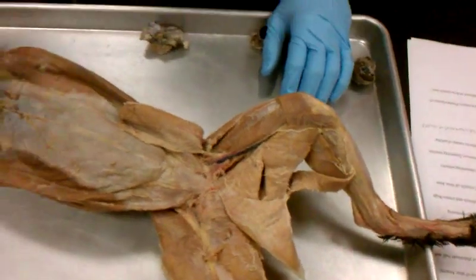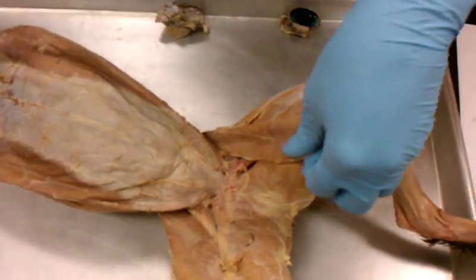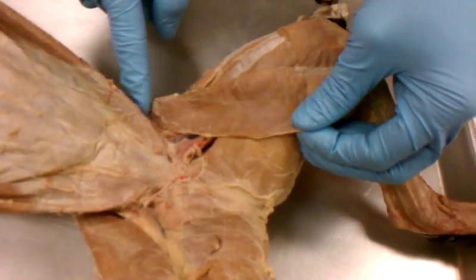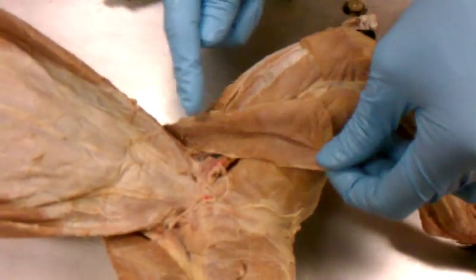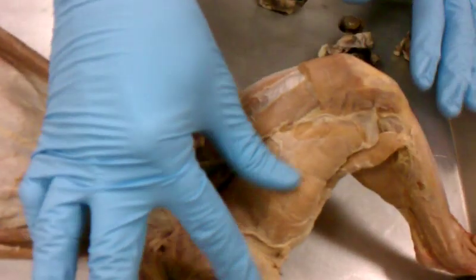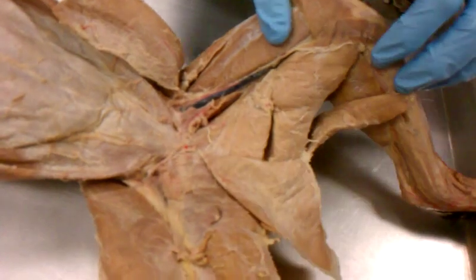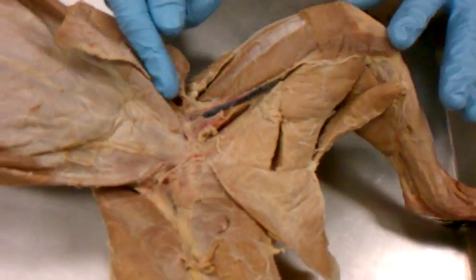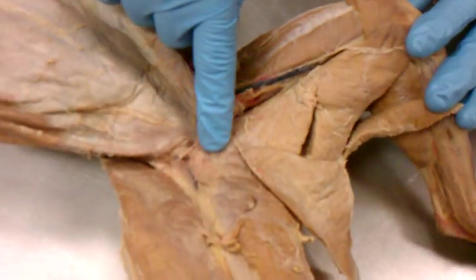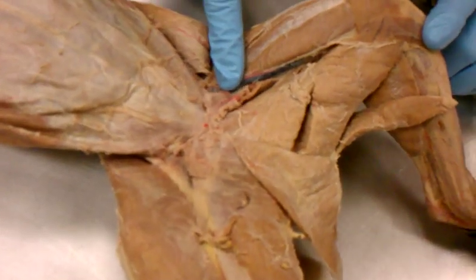Okay. Could you please go over the inside portion again? Yeah. Definitely. So, you have this one right here. This is your sartorius. It flaps, it goes from the iliac crest all the way around your leg. You pull that back and you have these of the inner thigh. Those are gracilis. You pull that back. You have all of these different parts in here. So you have the one that's right here. It's kind of destroyed some in this cat, but you can see it on this side a little better. So right there, that muscle, that's the adductor femoris.